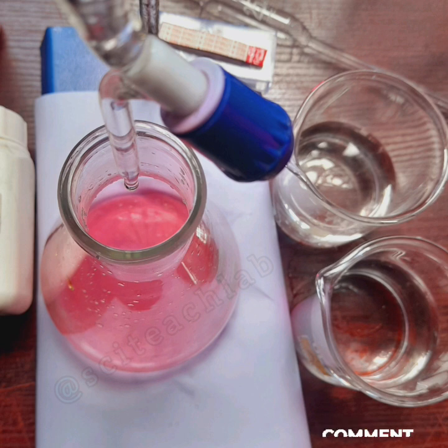That's because methyl orange operates and works well around pH of 3.1 to 4.4. Why we can't use phenolphthalein is because of the weakness of the base, sodium bicarbonate, and also the fact that phenolphthalein changes color in a pH range of 8.2 to 10.0. That's well above the pH of the neutralization of sodium bicarbonate and HCl. So in this titration, we're going to use methyl orange as indicator for precision.